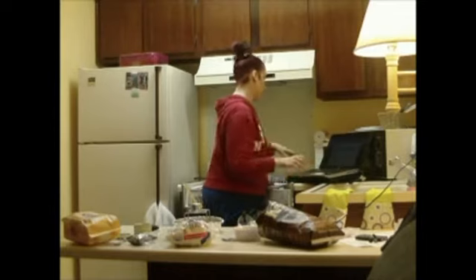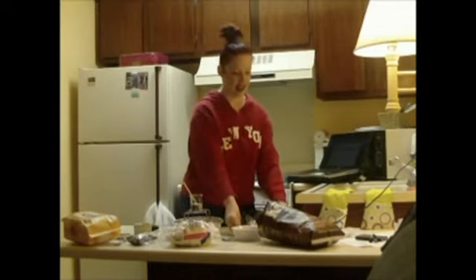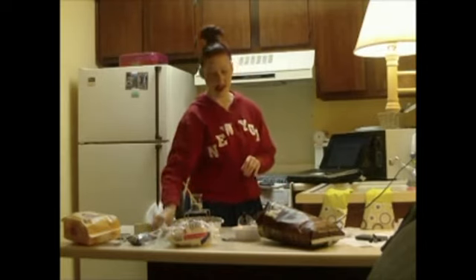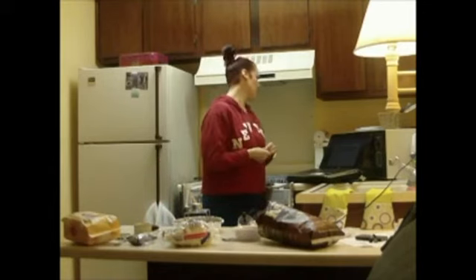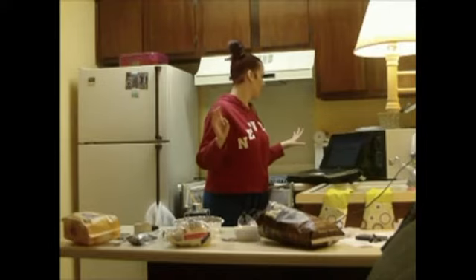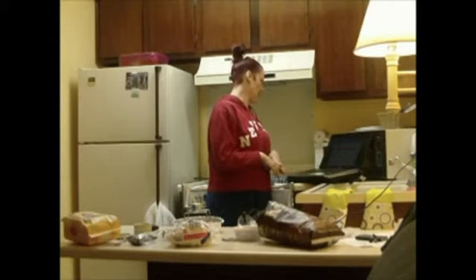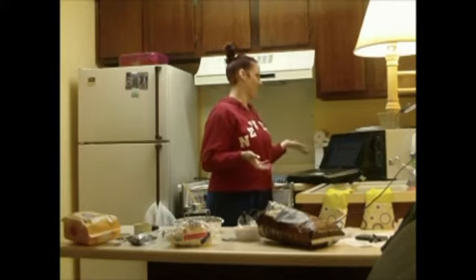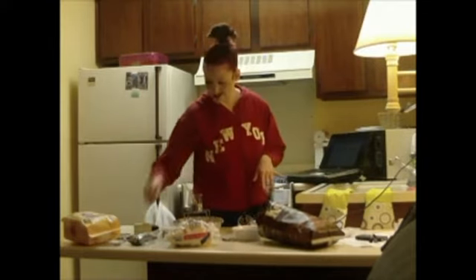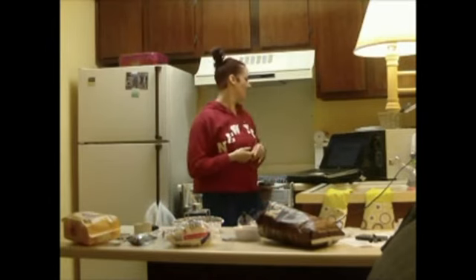I've got some forks here that I can hold things with, and I've got this little test tube holder I'm going to use for the nut because it can take the nuts a while to burn. For the mass of the beaker, I took some computations of that, and then the mass of the beaker with the water, subtract out the mass of the water. Okay, got 49.80 grams, pretty close to 50. I used a little pipette to try and measure as close as I could, but hey, human error.